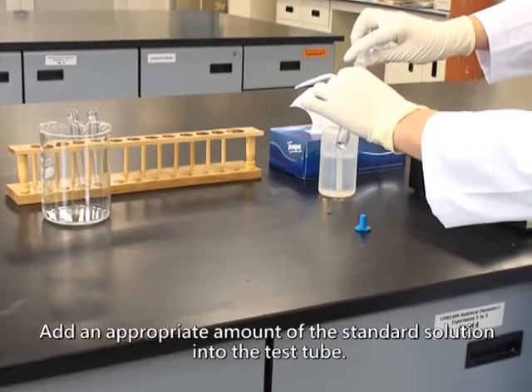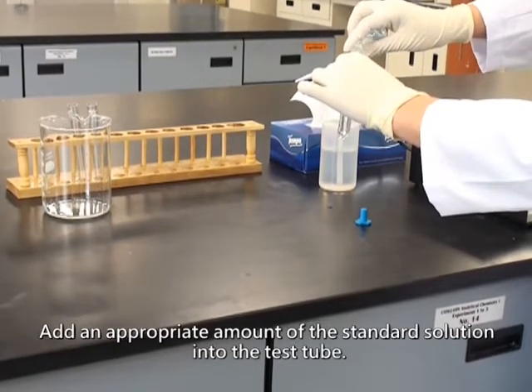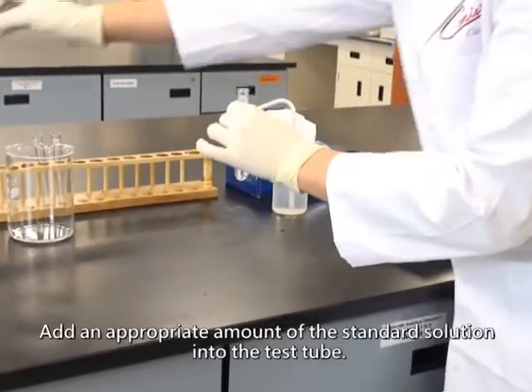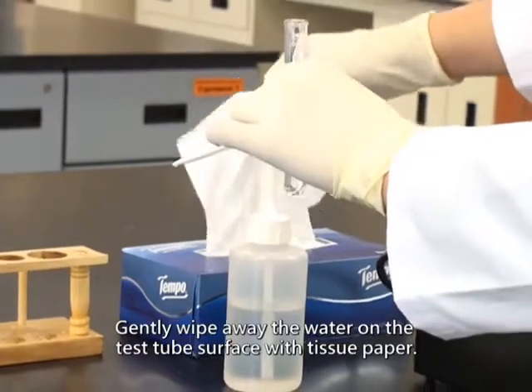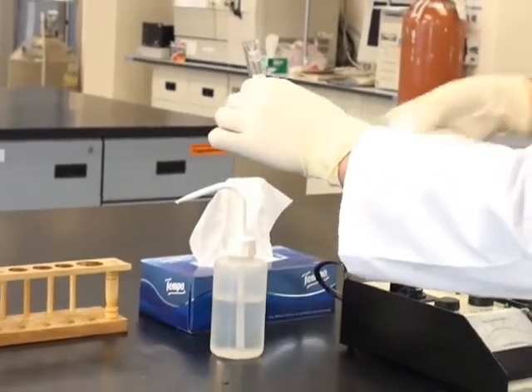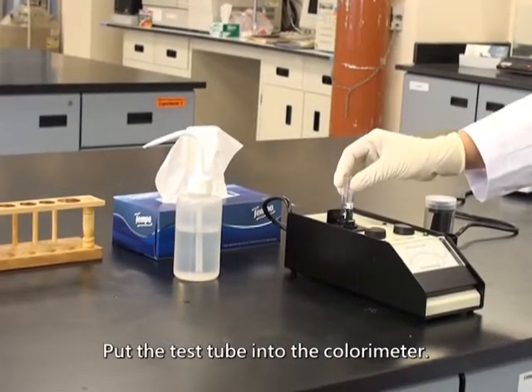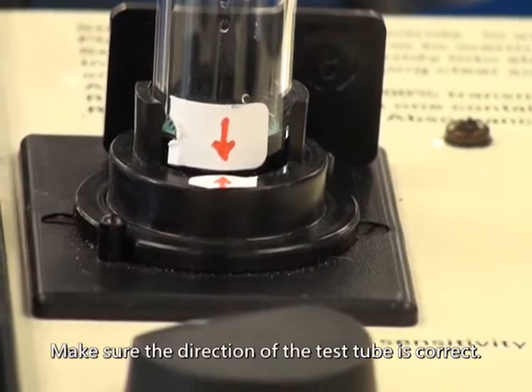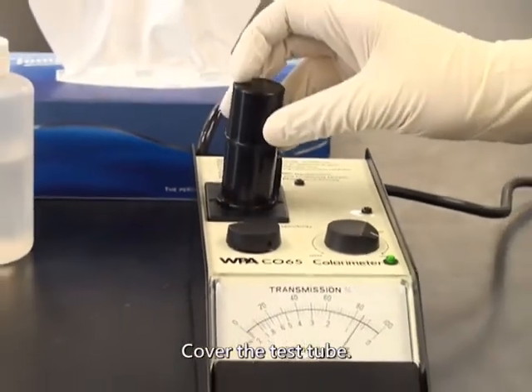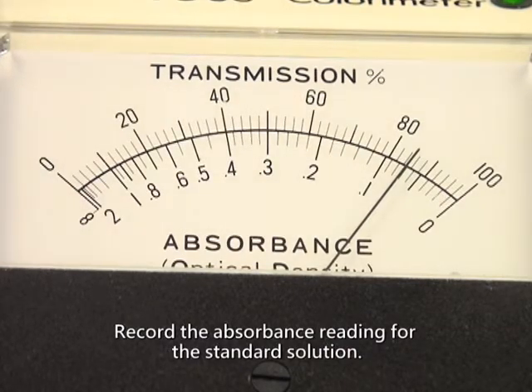Add an appropriate amount of the standard solution into the test tube. Gently wipe away the water on the test tube surface with tissue paper. Put the test tube into the colorimeter. Make sure the direction of the test tube is correct. Cover the test tube. Record the absorbance reading for the standard solution.